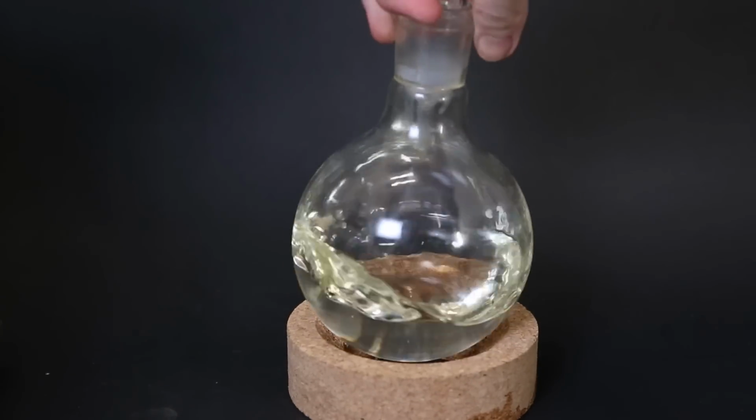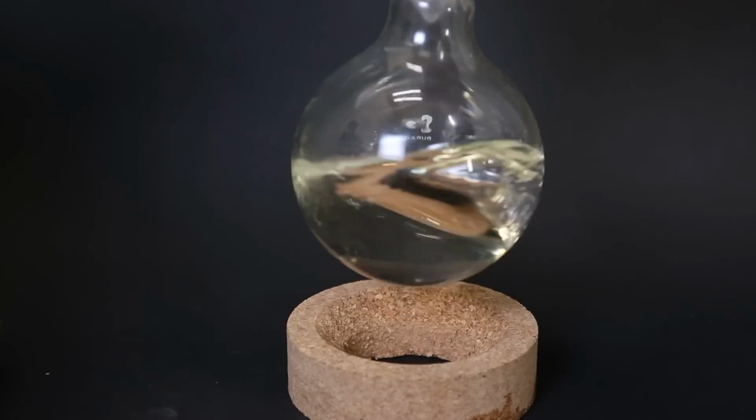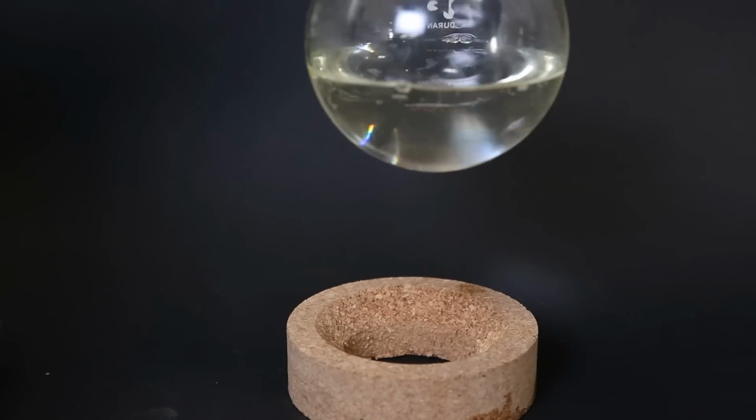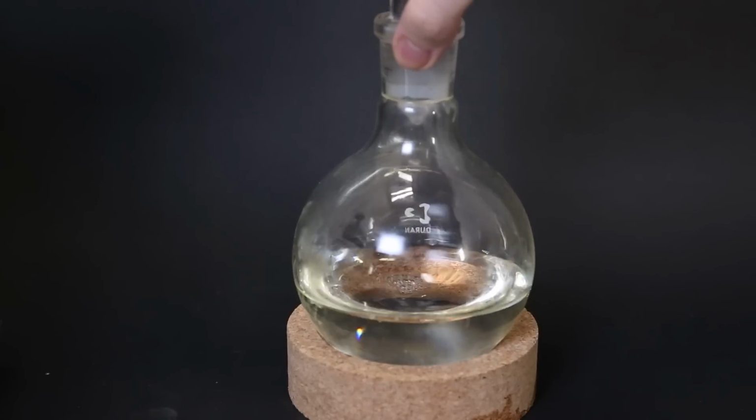Since cyclohexanone doesn't partake in the next reaction, it is not necessary to remove it yet, and after the reaction, when I want to collect the 2-methylcyclohexanone, I can separate them anyway. Now I start building a regular reflux setup.